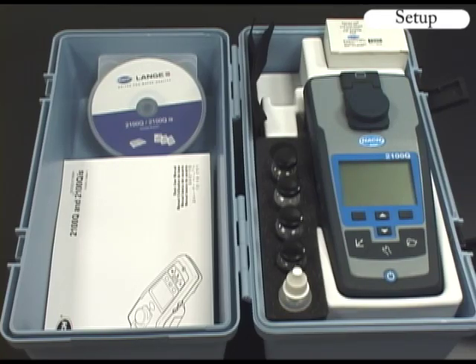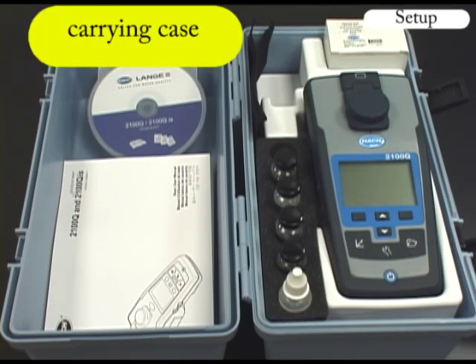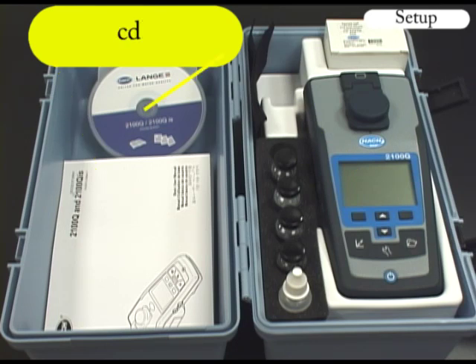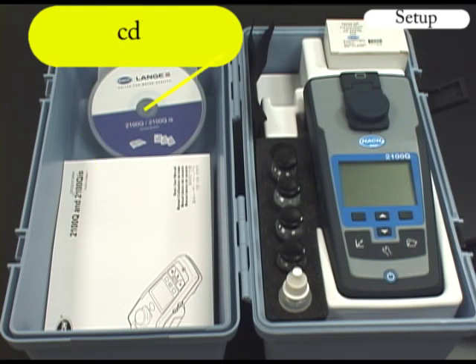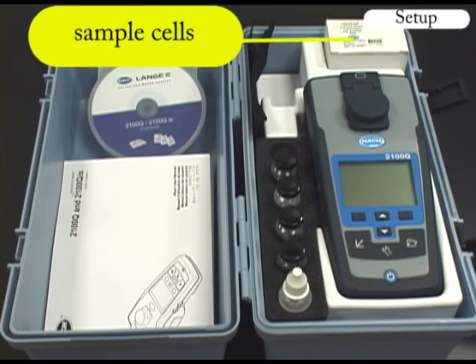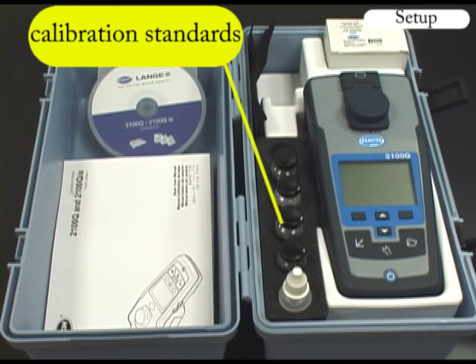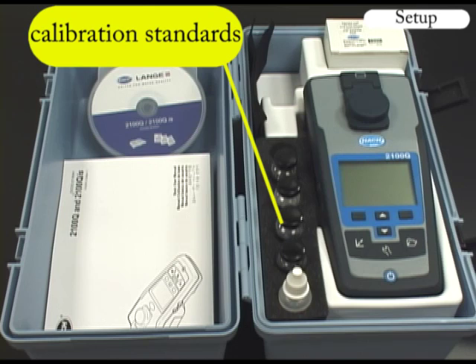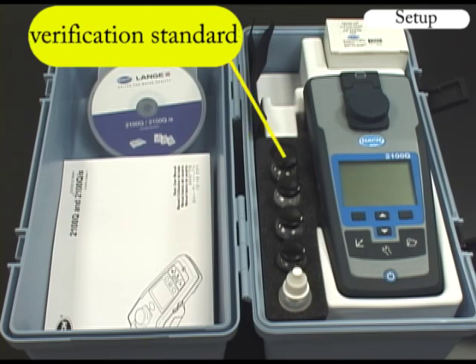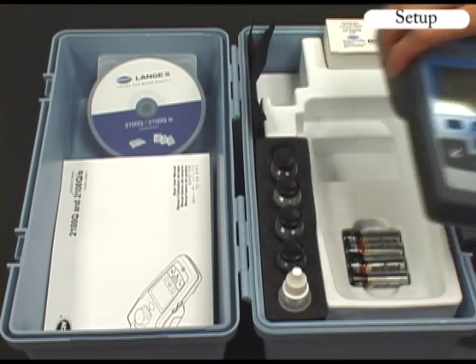This is a view of the 2100Q and its components, including the carrying case, the meter, printed basic user manual, full user manual on CD-ROM, silicone oil and oiling cloth, a package of six sample cells with caps, three StableCal calibration standards at 20, 100, and 800 NTU, a 10 NTU StableCal verification standard, and four AA alkaline batteries.